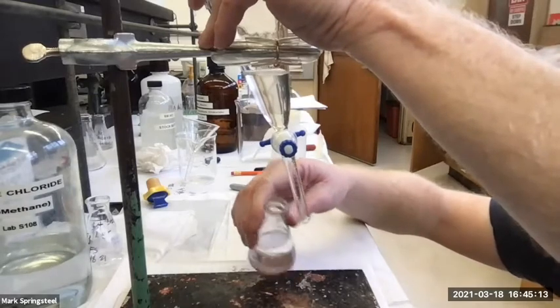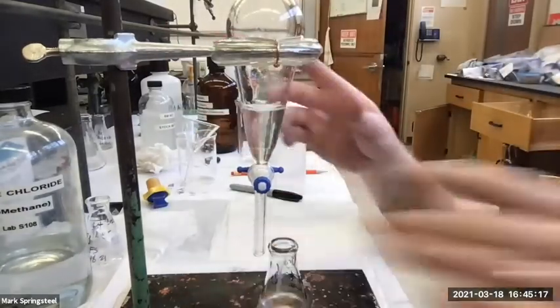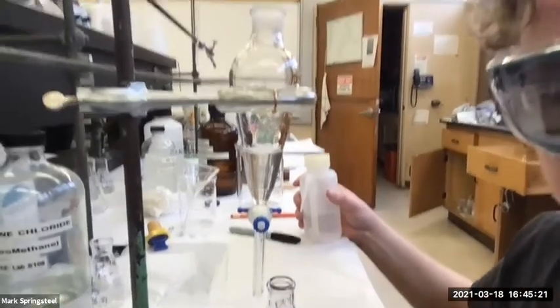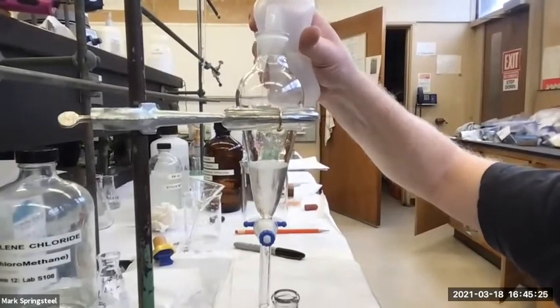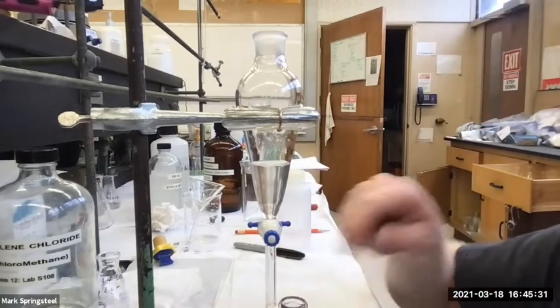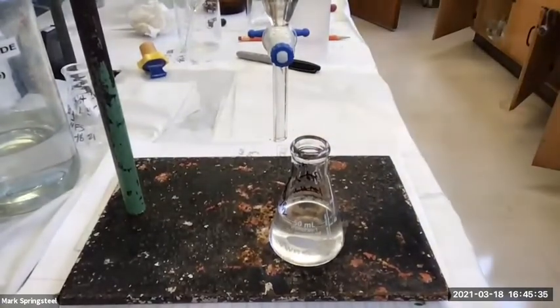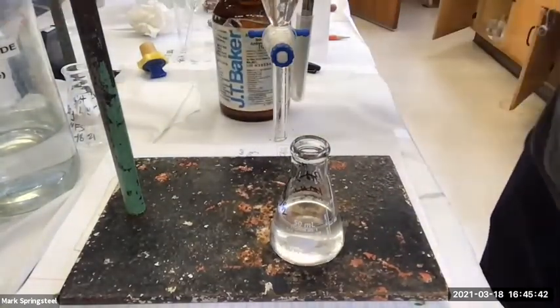Okay, so now I've got my pre-dried organic layer. My aqueous layer is left up above. If I wanted to check, I haven't really been checking as much as I usually do when I teach this, but I can shoot a little water into this and check that it doesn't make two layers. It did not make two layers. That's definitely the aqueous layer. So I'm good with that being the organic layer. And I'm going to add some sodium sulfate. I have my anhydrous sodium sulfate here.